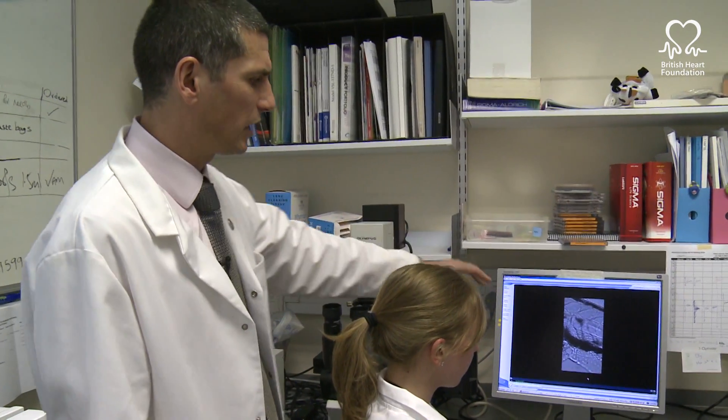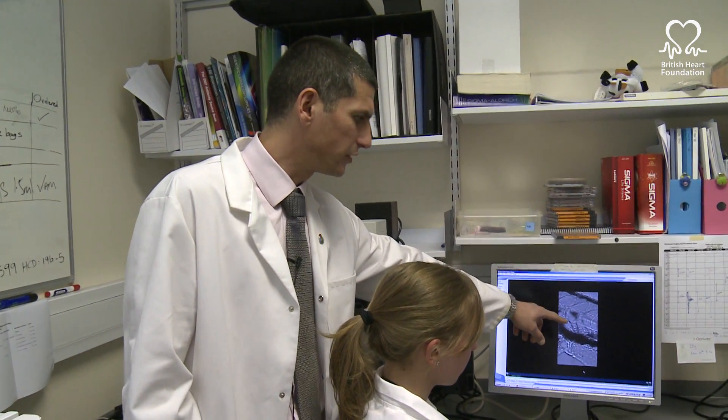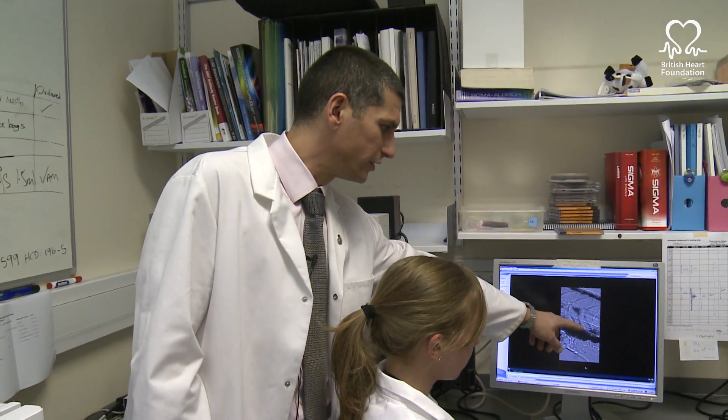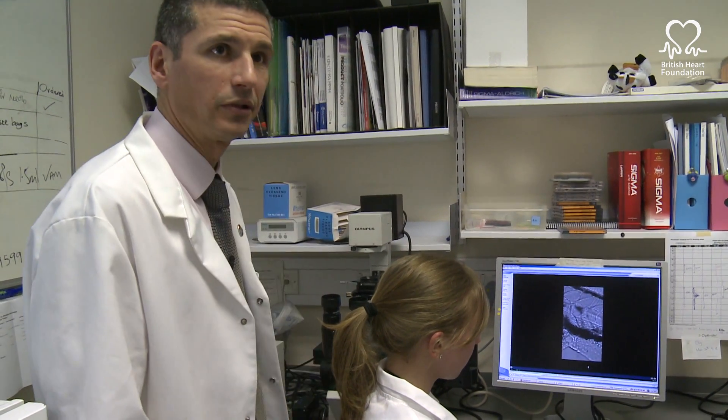What we're studying here is how blood clots form in the blood vessel of a zebrafish. Just here you're going to see a blood clot develop.